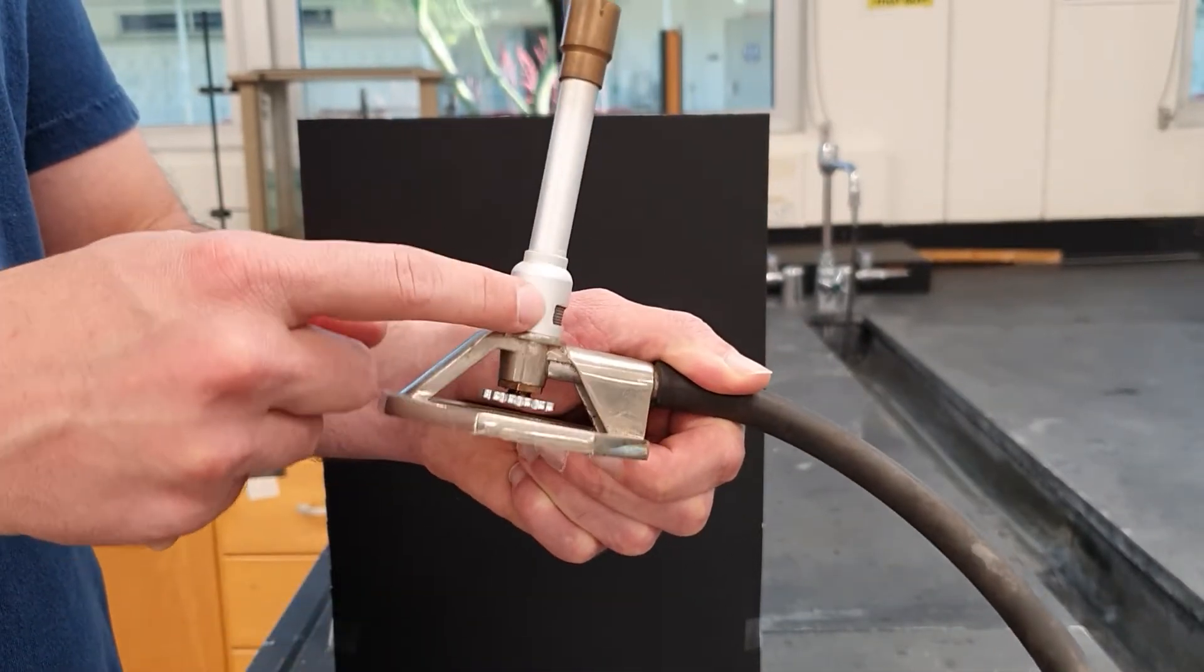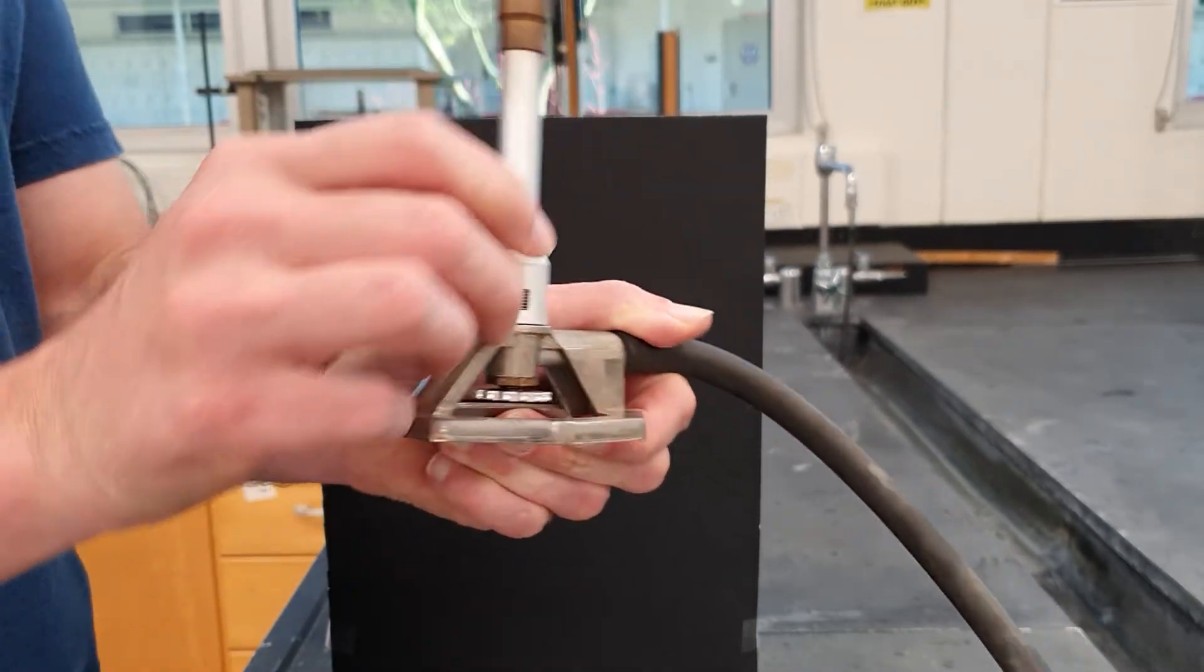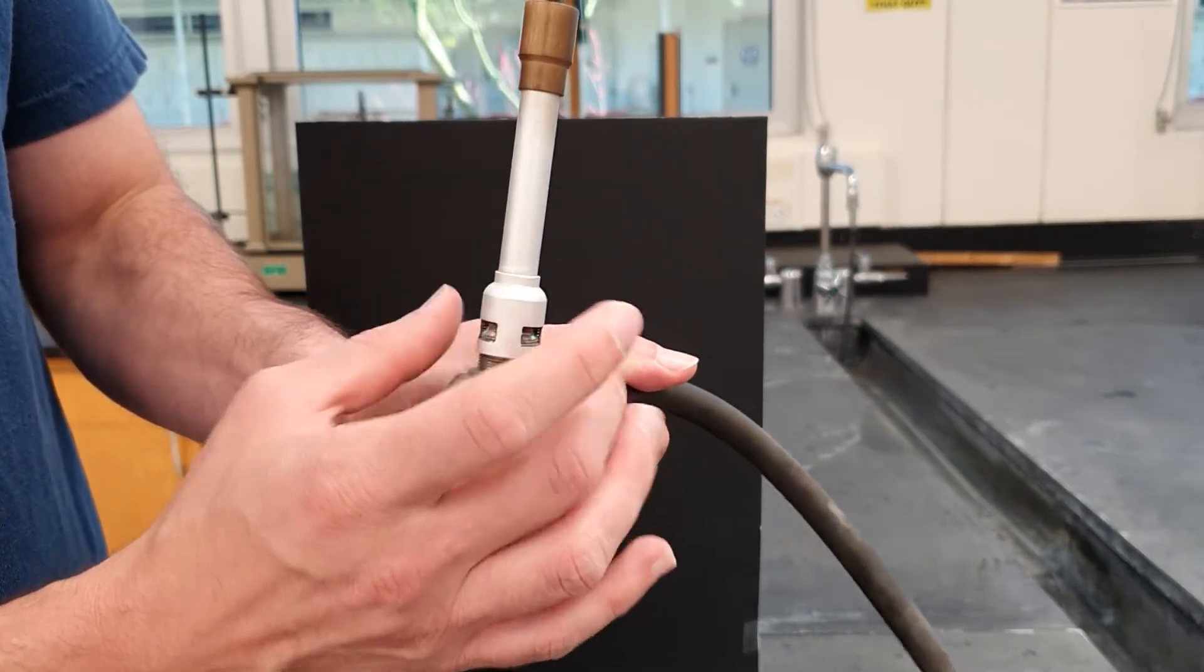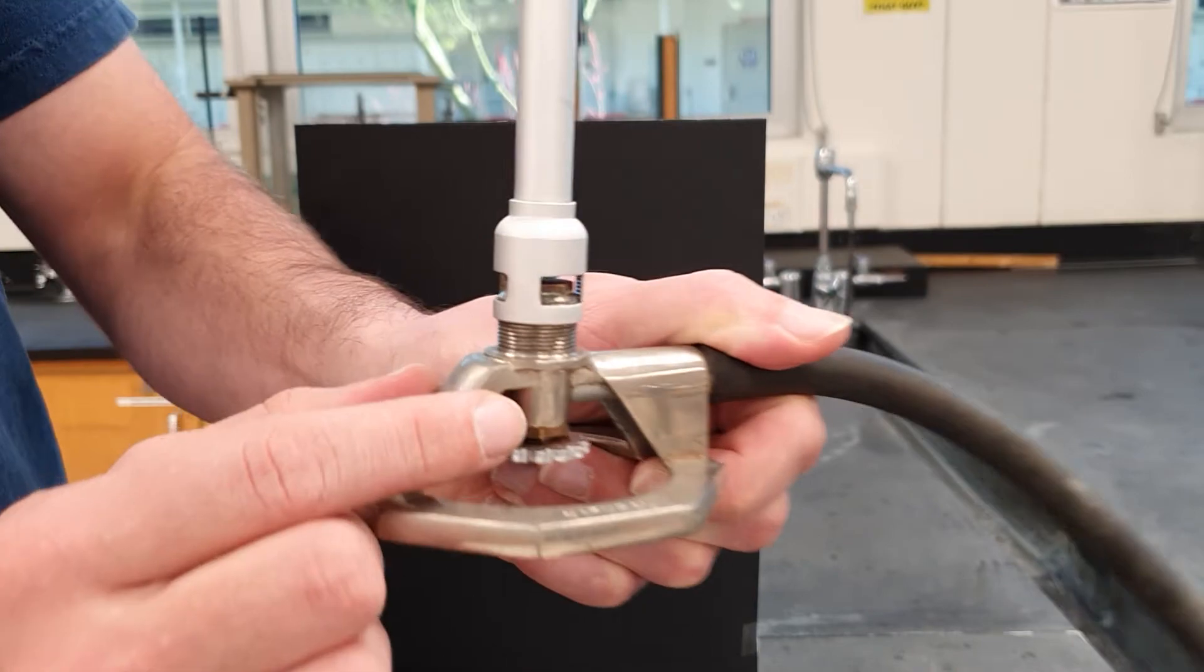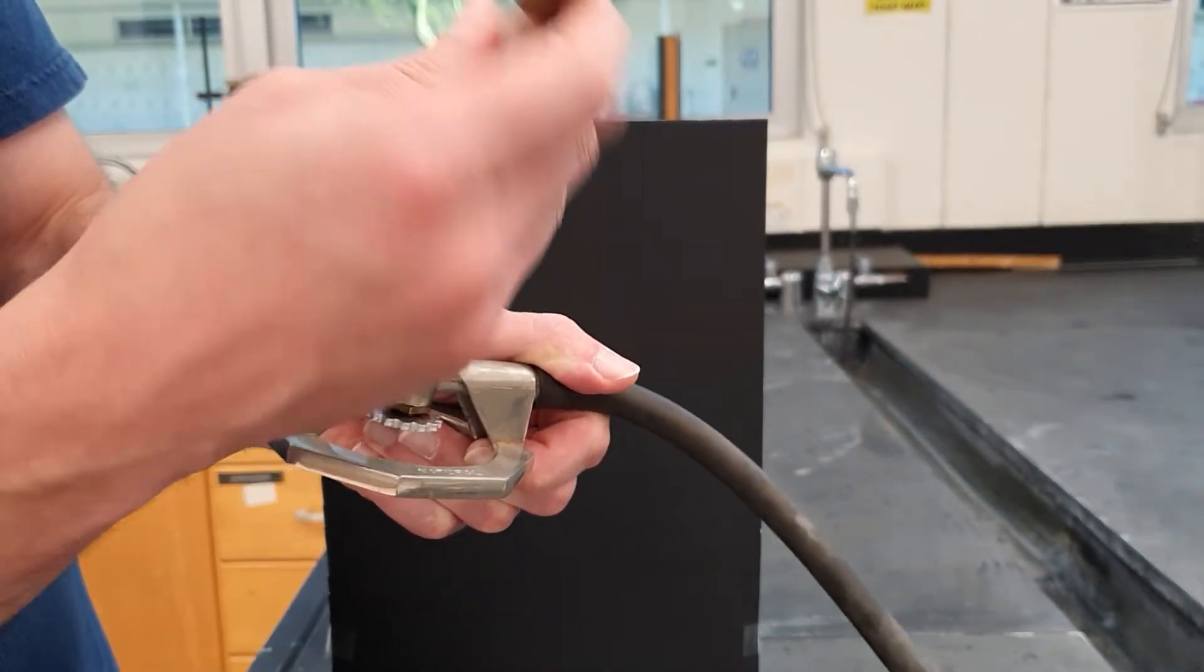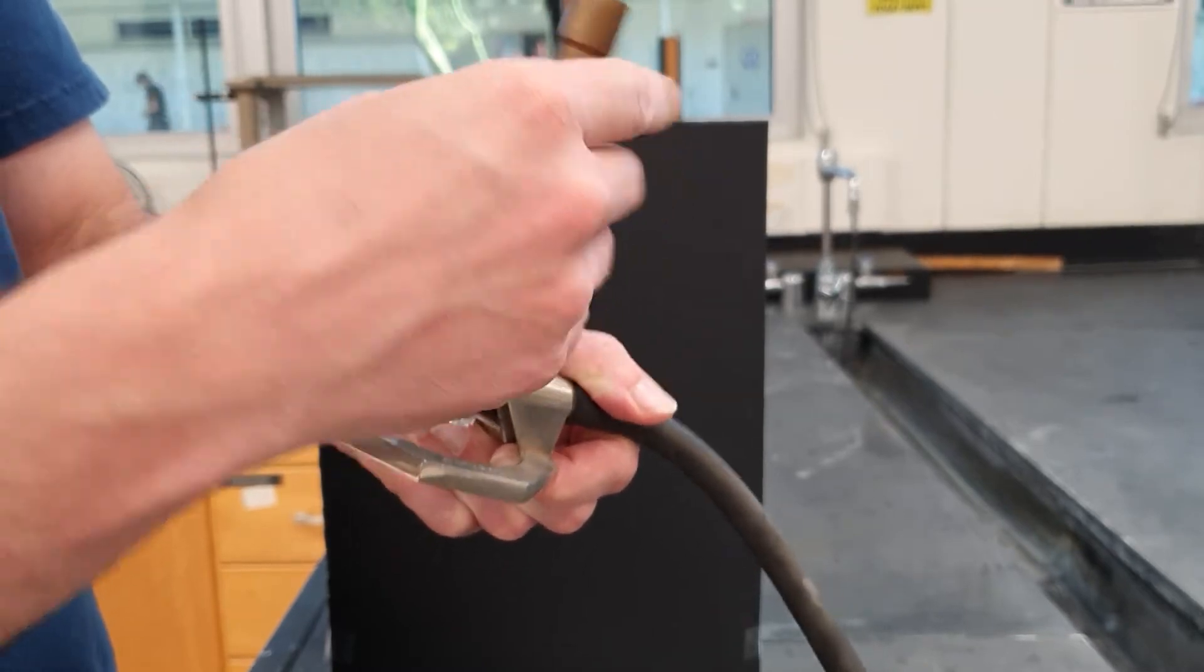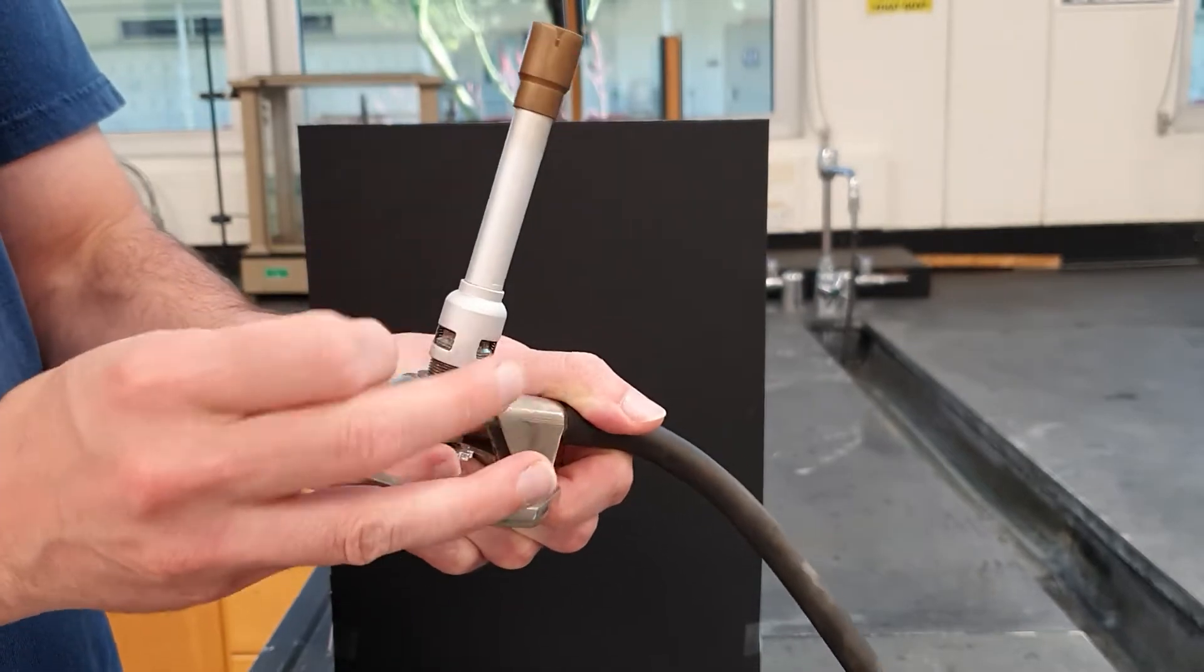This, on the other hand, is the valve that controls the airflow. When you turn that valve that controls the airflow and move it upward, this opens up a gap at the top, and the bigger that gap, the more air goes in. This is about as high as you would want to be unscrewing it. You don't want to go any further, because if you go too far, that happens, and you don't want that to happen when the flame is lit. So you do open it to adjust the airflow by opening it to have more, and close it to have less.